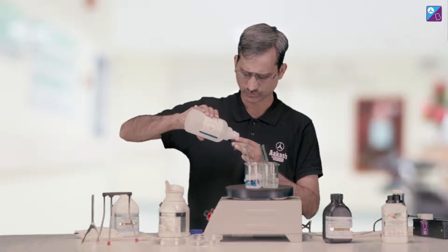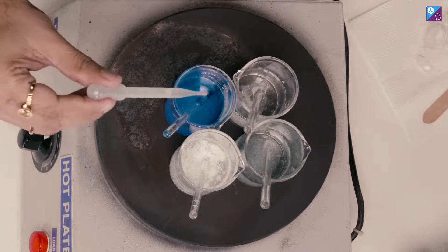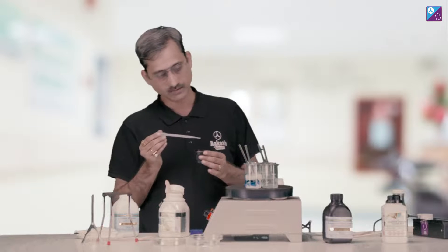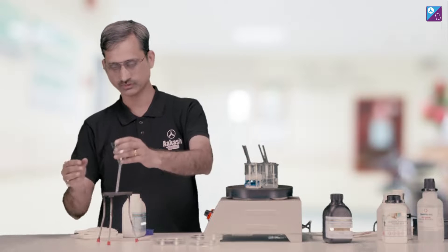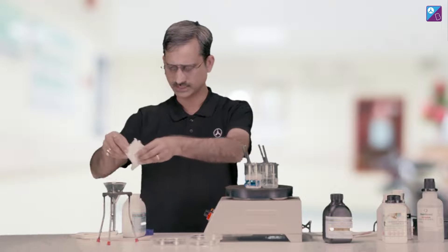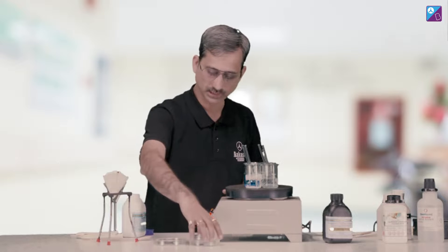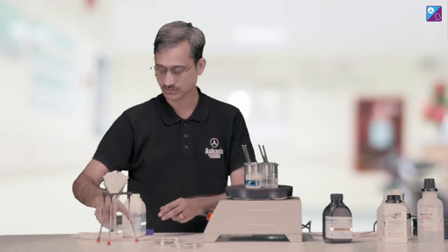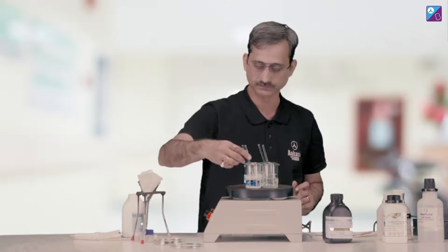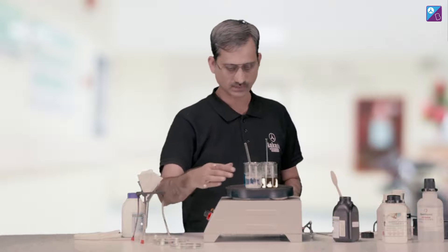Not much — just a few drops of sulfuric acid would do the trick. We are going to add sulfuric acid to the potash alum, copper sulfate, and ferrous ammonium sulfate. Of course, we are not going to add sulfuric acid to the benzoic acid. Now we prepare for the first filtration, which is going to be of benzoic acid, because once the benzoic acid is dissolved and cooled it will immediately crystallize. So let's start filtering.